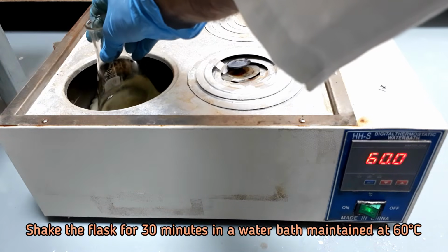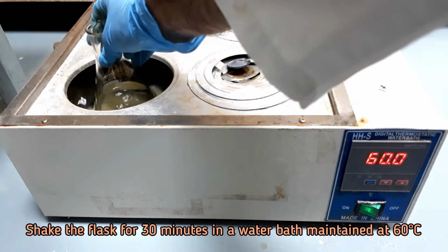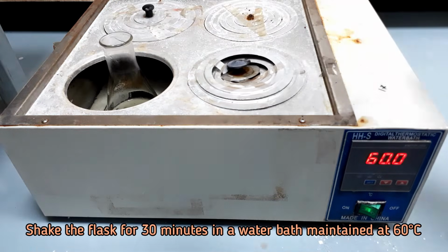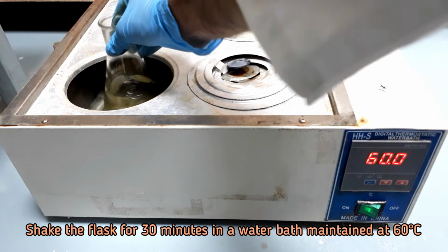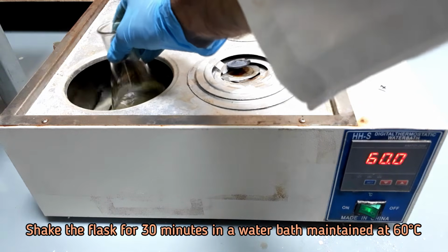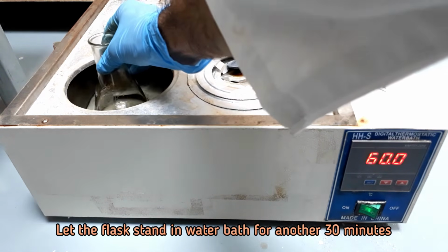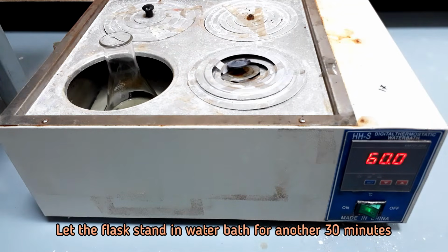Shake the flask for 30 minutes in a water bath maintained at 60 degrees Celsius. Let stand in water bath for another 30 minutes.